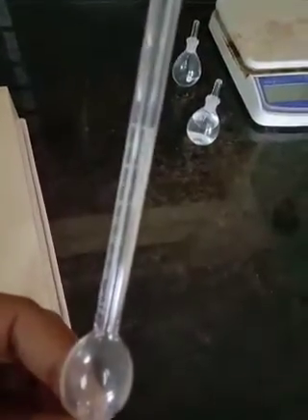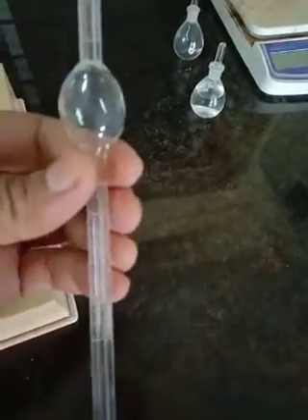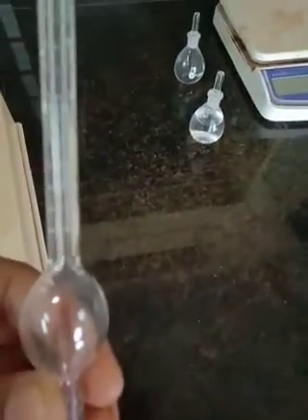You can see the marks are made on the stalagmometer — the upper mark and the lower mark are visible on the lower portion of the tube. This is the bulb in the middle section.